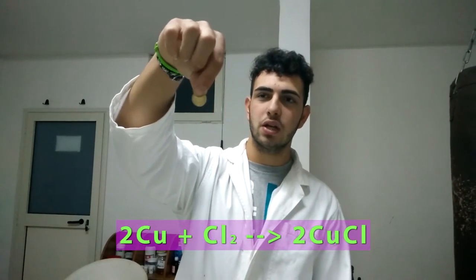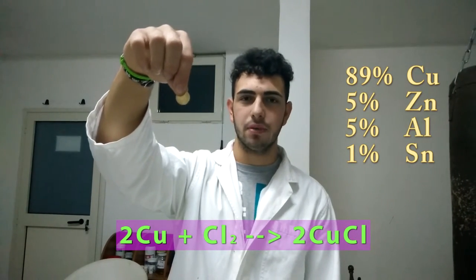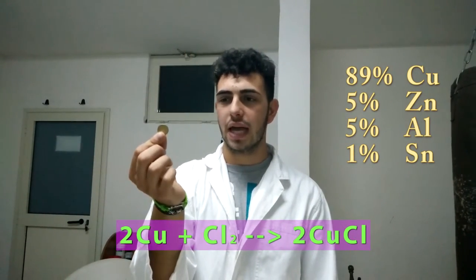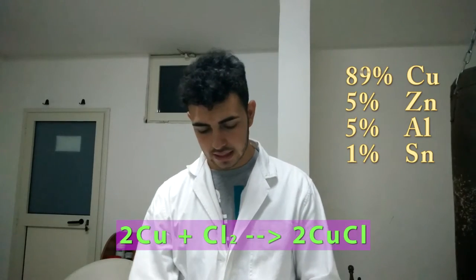Another experiment, which is also the last that we can do with chlorine, is making it react with another coin — not the 5 cent coin but the 10 cent coin. As we can see, it has a different color because it is made of a different metal, which is copper this time. Copper will react with chlorine at a different speed and will form another substance with a different color. So let's see the reaction and what happens.